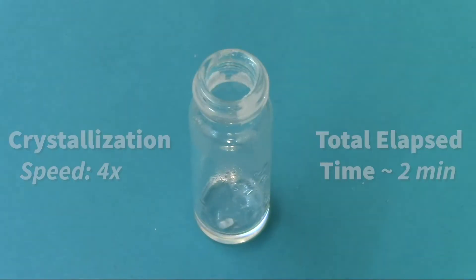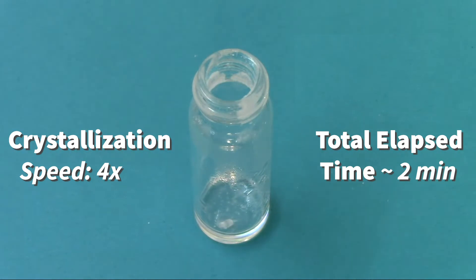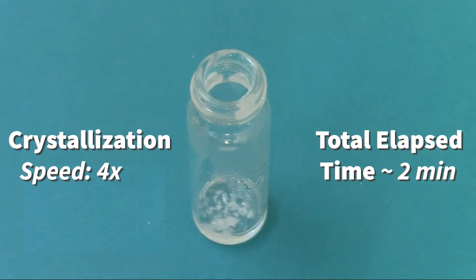We'll watch everything crystallize. So I'll drop that in there and then we're going to just watch this for a few minutes and see what happens. And while that's going on, I want to talk to you a little bit about crystals.